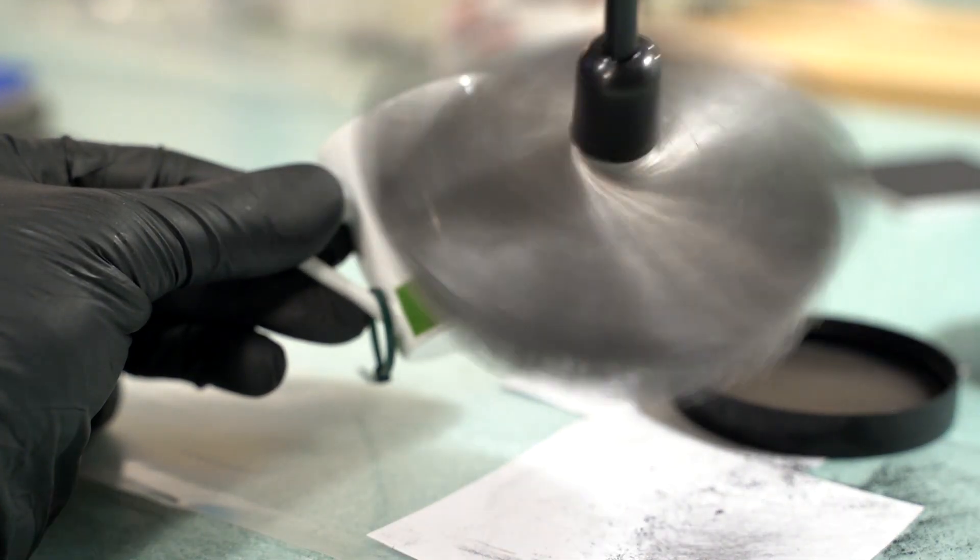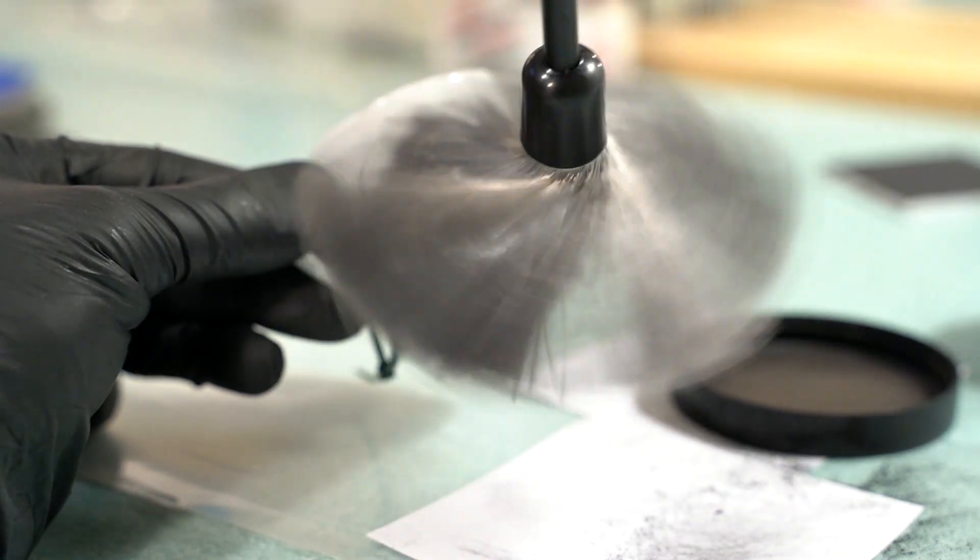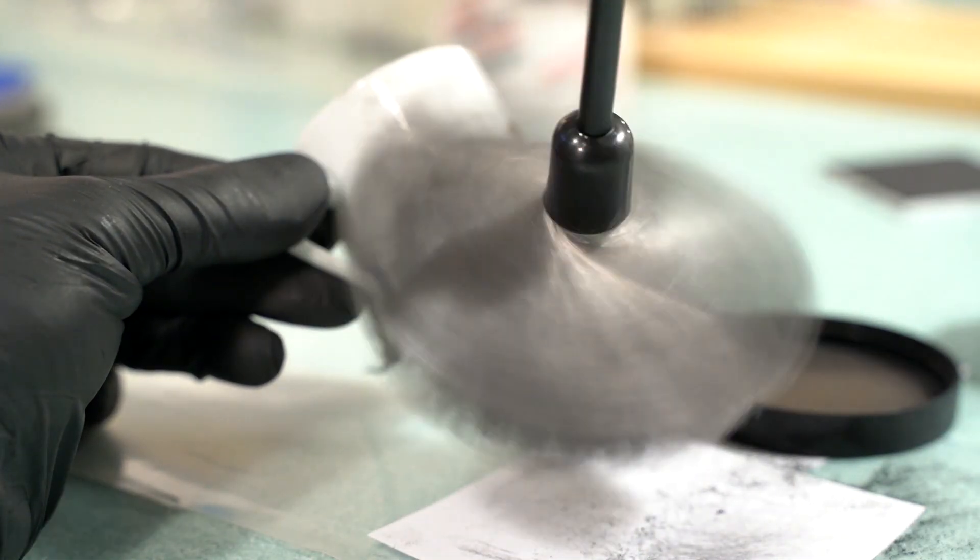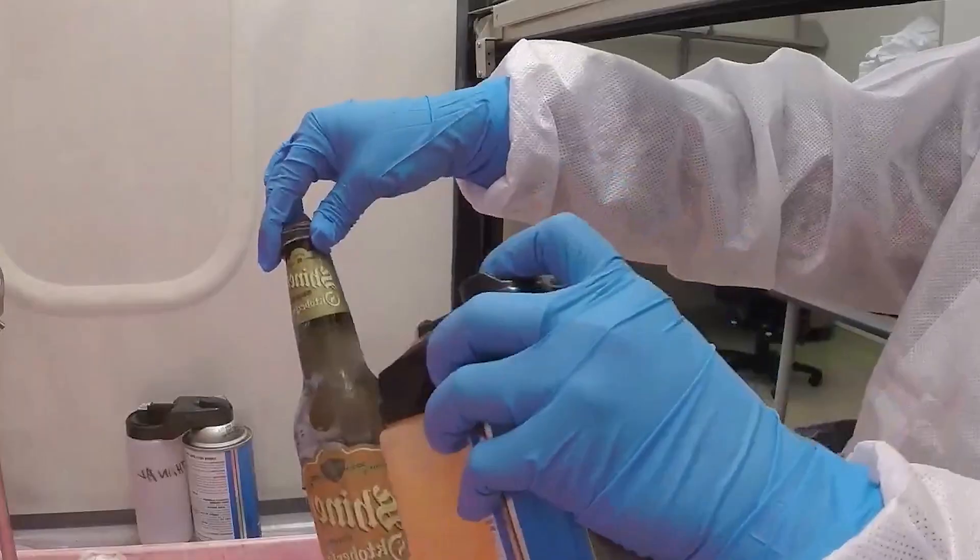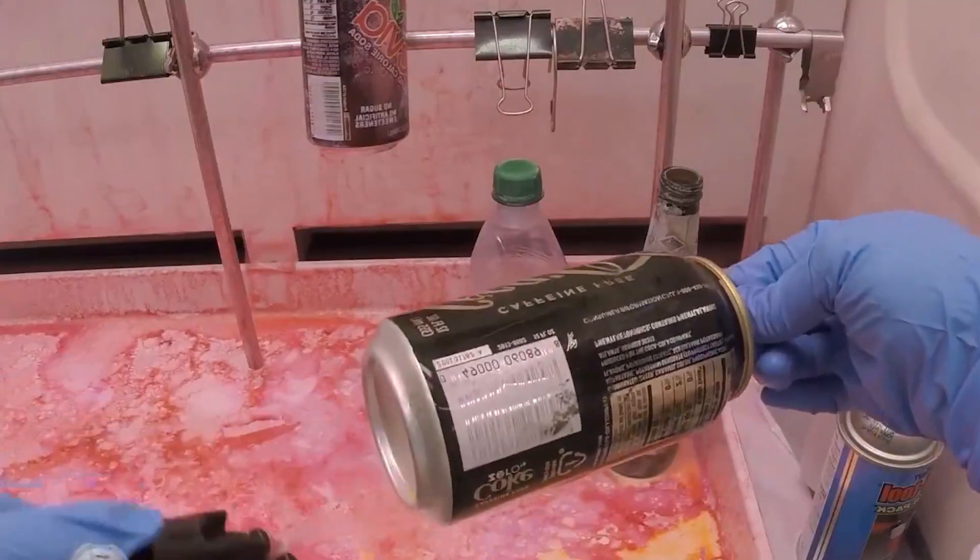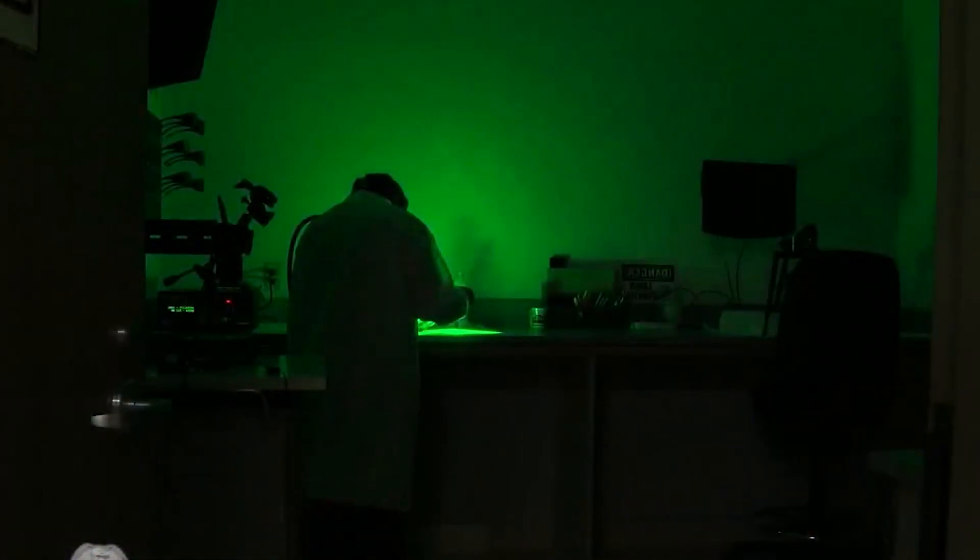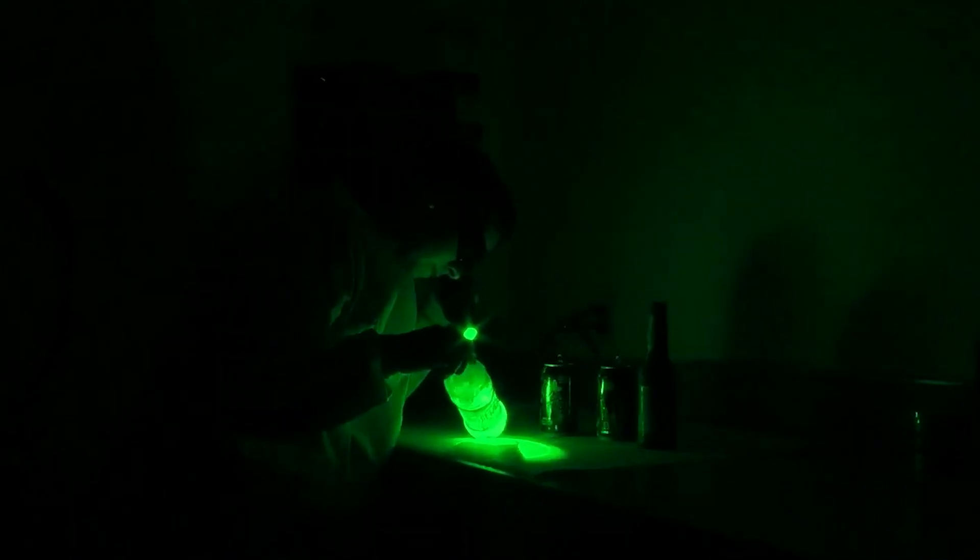The cyanoacrylate developed prints may be used as is or further enhanced by dusting with regular or metallic fingerprint powder and or staining procedures. This is to help the prints stand out better for easier and more reliable identification.